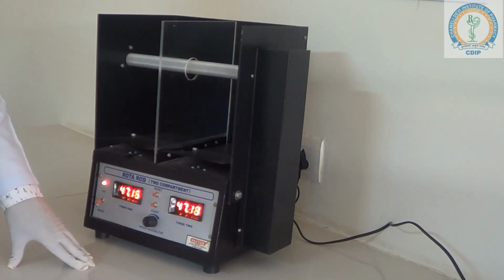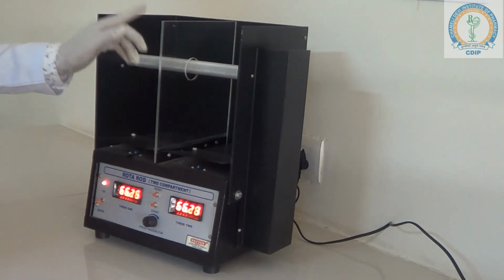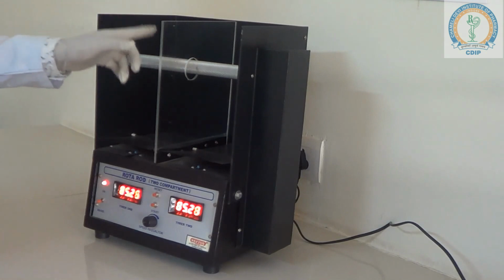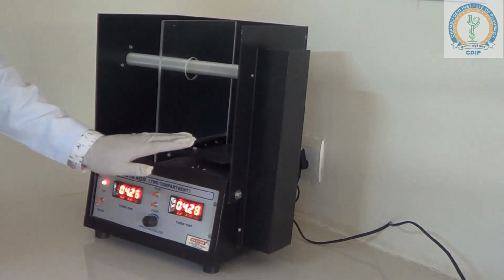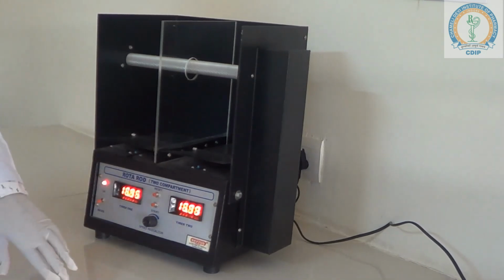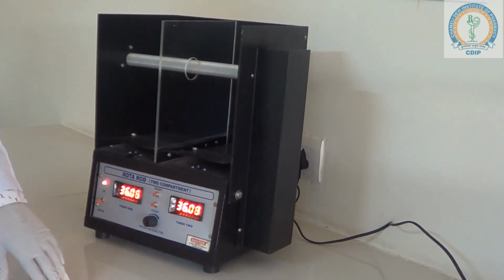Now we are going to discuss the experimental procedure of Rotarod apparatus. The mice are made to balance on this rod depending upon their motor coordination, central nervous activity and grip strength. The animal either stays on the rotating rod for a specific time, after that falls down on the platform of each compartment. The floor of each compartment has a sensor that deactivates the timer. The exact fall time of each rat or mice is displayed on the respective display.